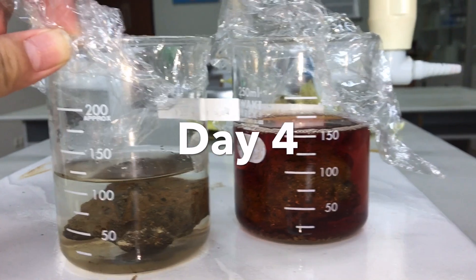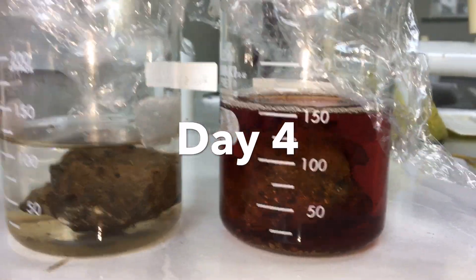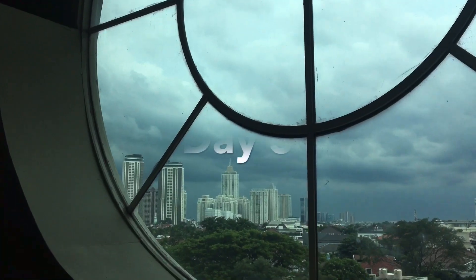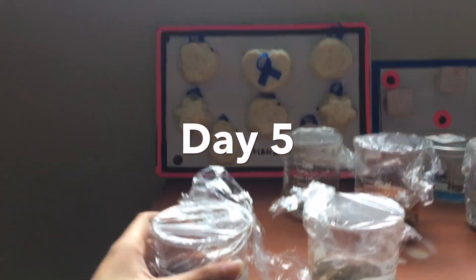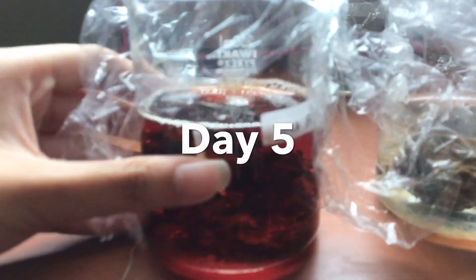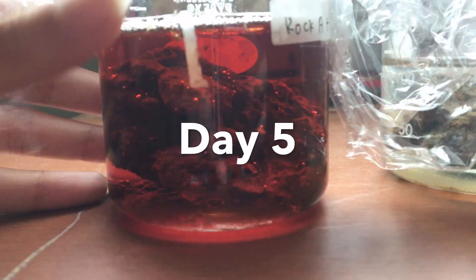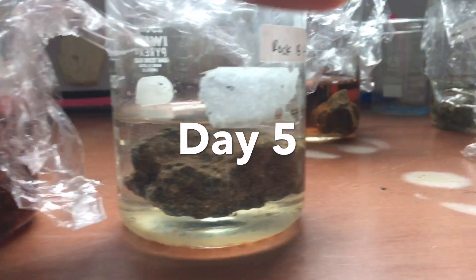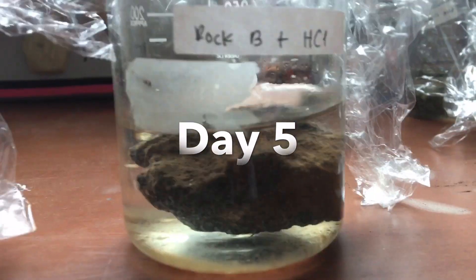So that is all for day four. Bye guys. Hey guys, so it's day five. And this is rock A, which is with vinegar. It's like red and with just a few bubbles in there as you can see. And this is rock B with HCl.